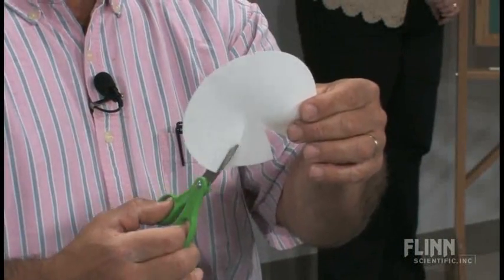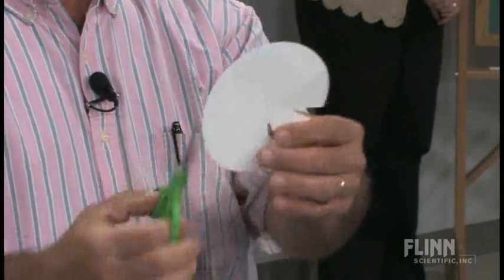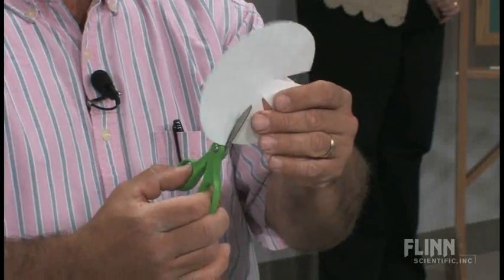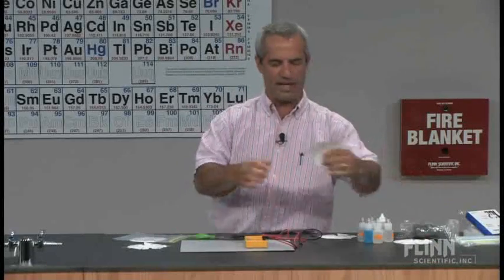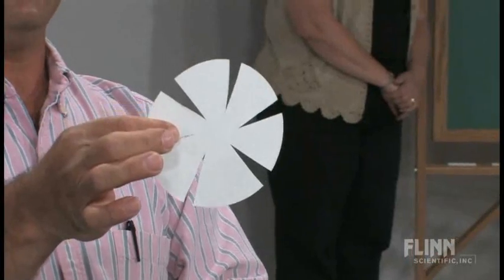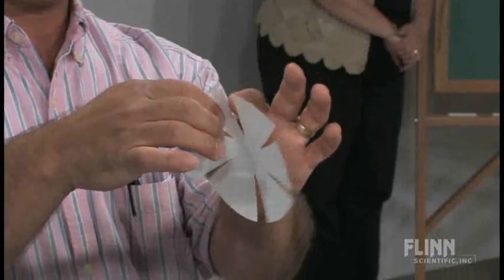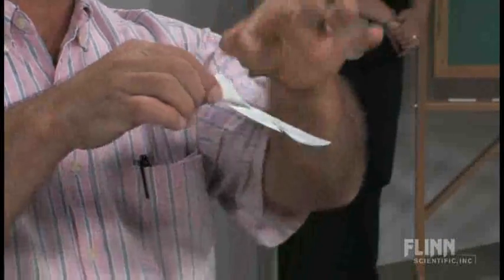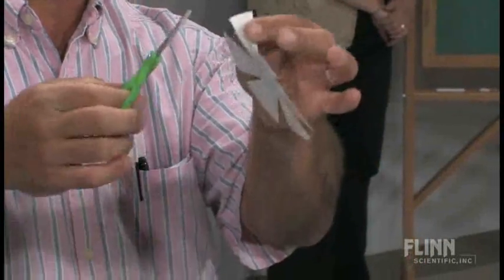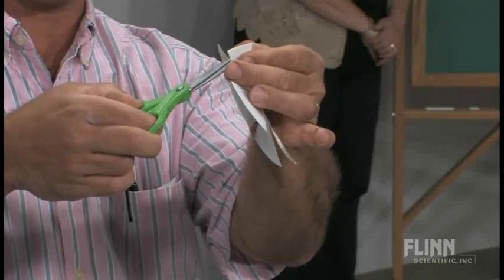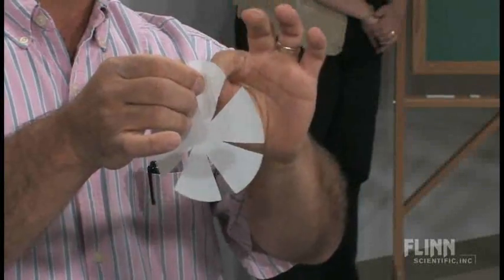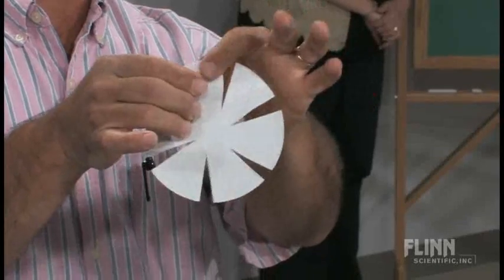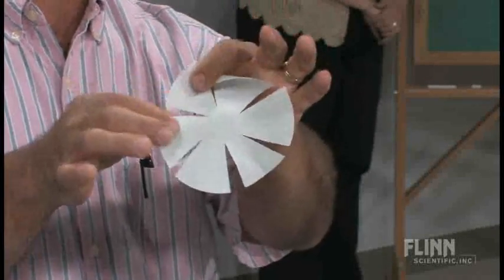Then they take a piece of filter paper and cut little wedges out of it. I have an example of this for them to do. They're trying to make six little petals, like a little flower. When they're done, they'll have something looking like this. It doesn't have to be perfect. Then they have to make two little slits near the edge of each of these. So they fold it in half a bit and make two little cuts like that.